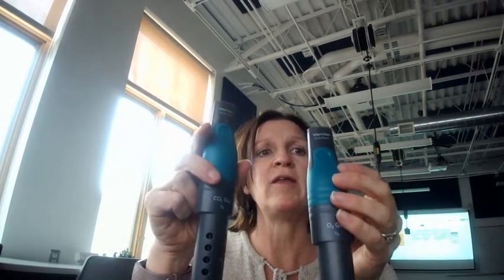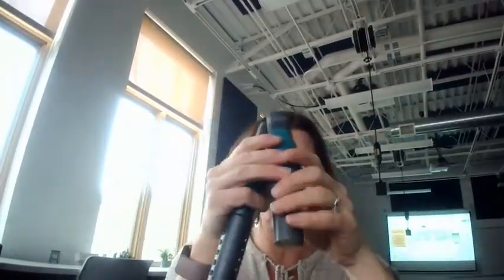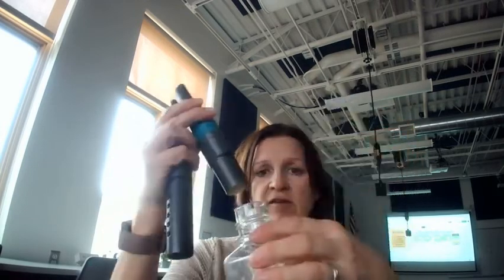So when you're ready to go, the easiest thing to do is to use a USB cord and hook them up to your Chromebook. The USB cord is going to go right in the top here. And then once the USB cord is in, you're going to use this container. You're going to put whatever you're testing in the container, get it all ready to go, and then you're going to put this on and it makes a nice tight seal.